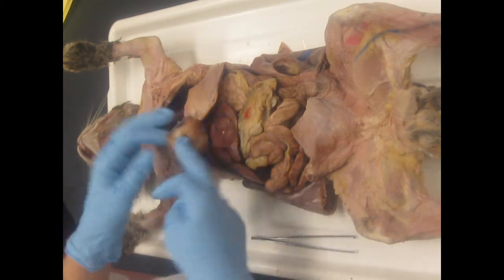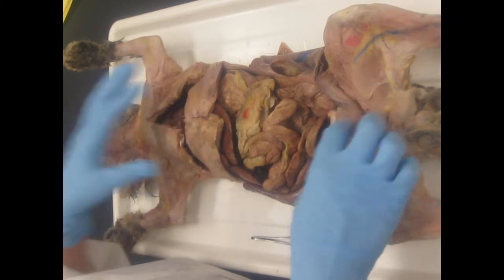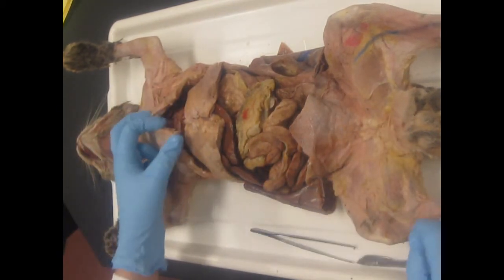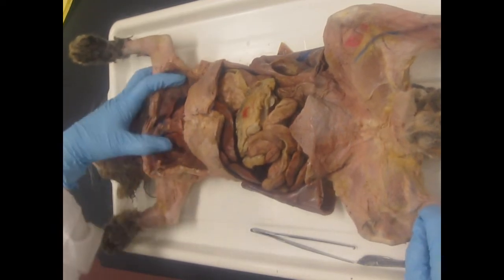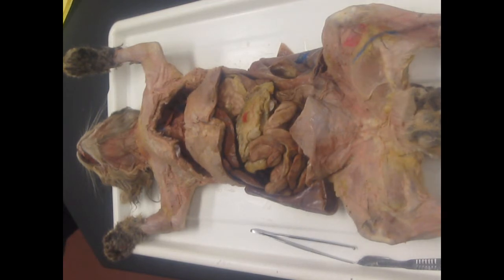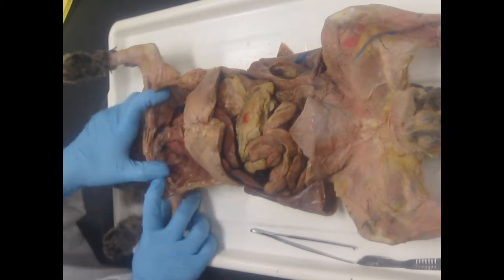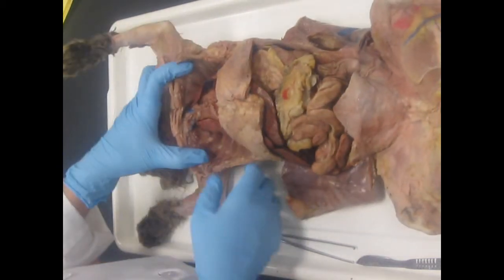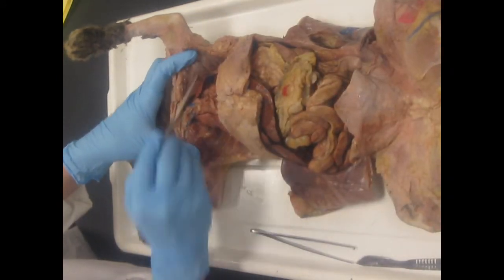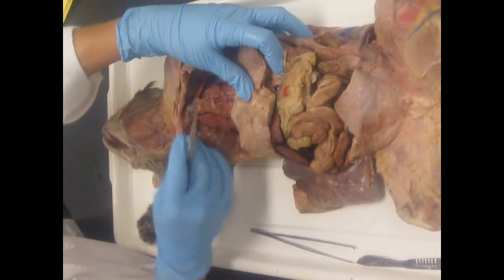Okay, and then the abdominal and pelvic cavities are below the diaphragm. Now, some membranes. Remember that the parietal always lines the cavity wall. The visceral layer always lines the organ. And the rest of the name of the membrane is just the cavity name. So we're going to start with parietal pleura. That has to be on the wall of the thoracic cavity, parietal pleura. Visceral pleura is on the organ.